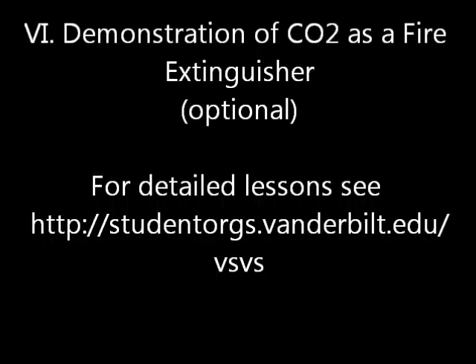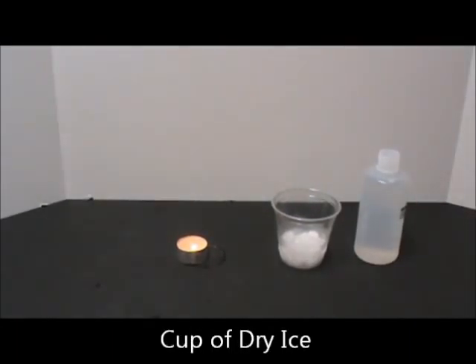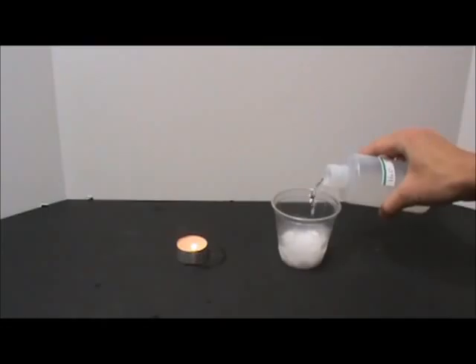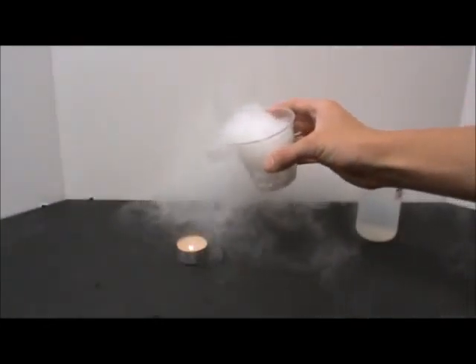Demonstration of CO2 as a fire extinguisher. For this demonstration, you will need a tea candle, matches, a cup of dry ice, and water. Pour the water into the dry ice. Then tip the cup to allow carbon dioxide to fall on the candle. Do not pour out the water.